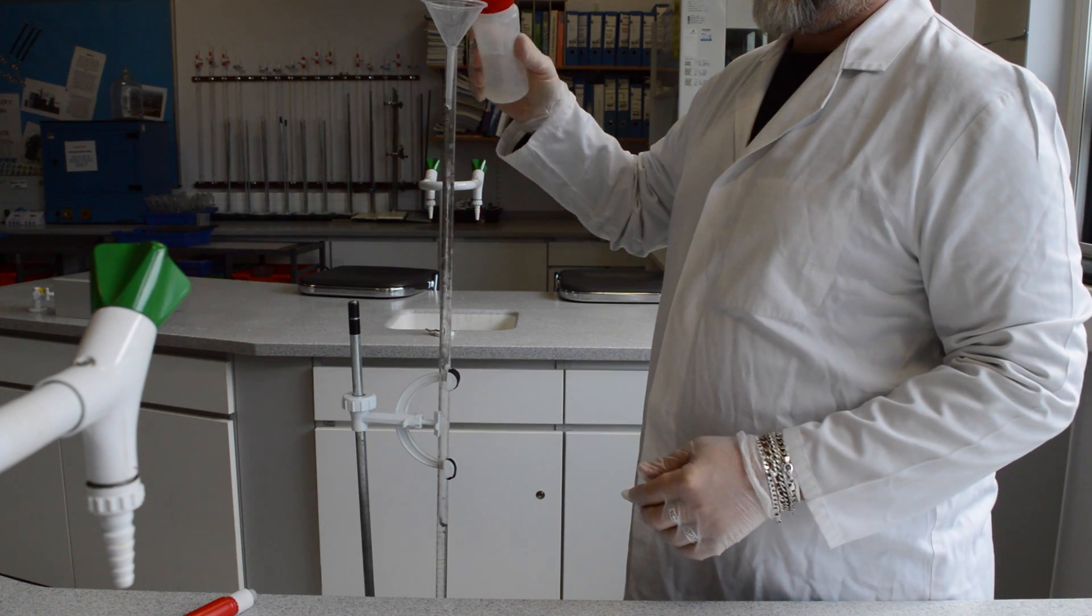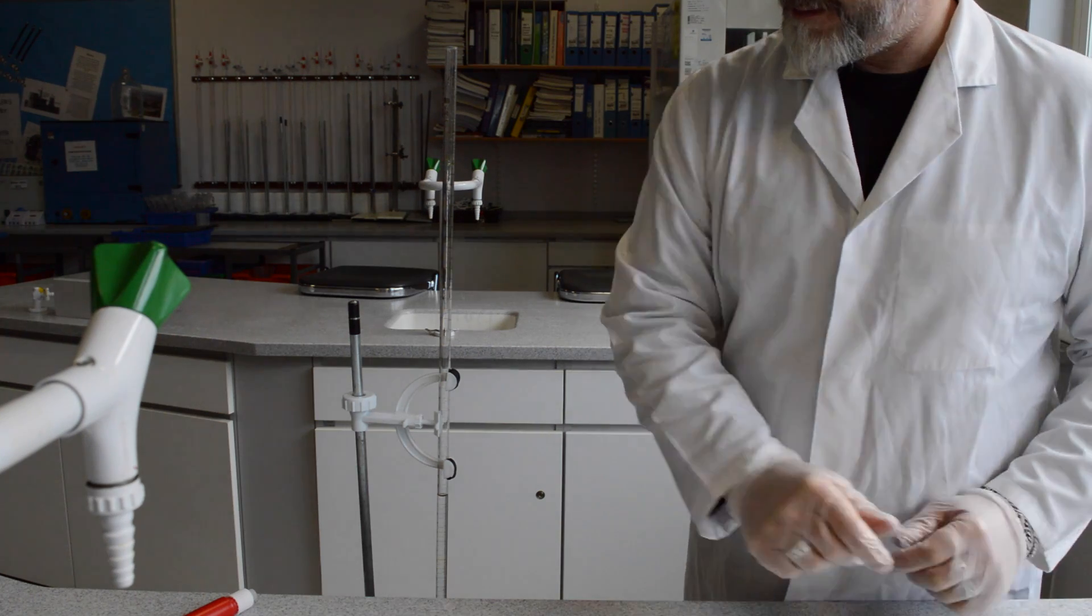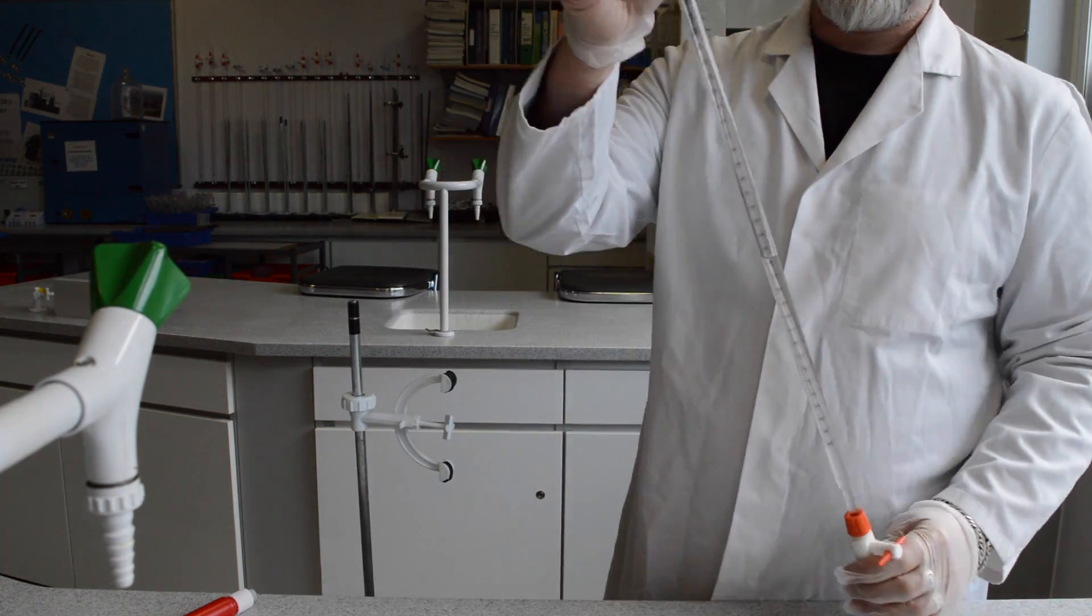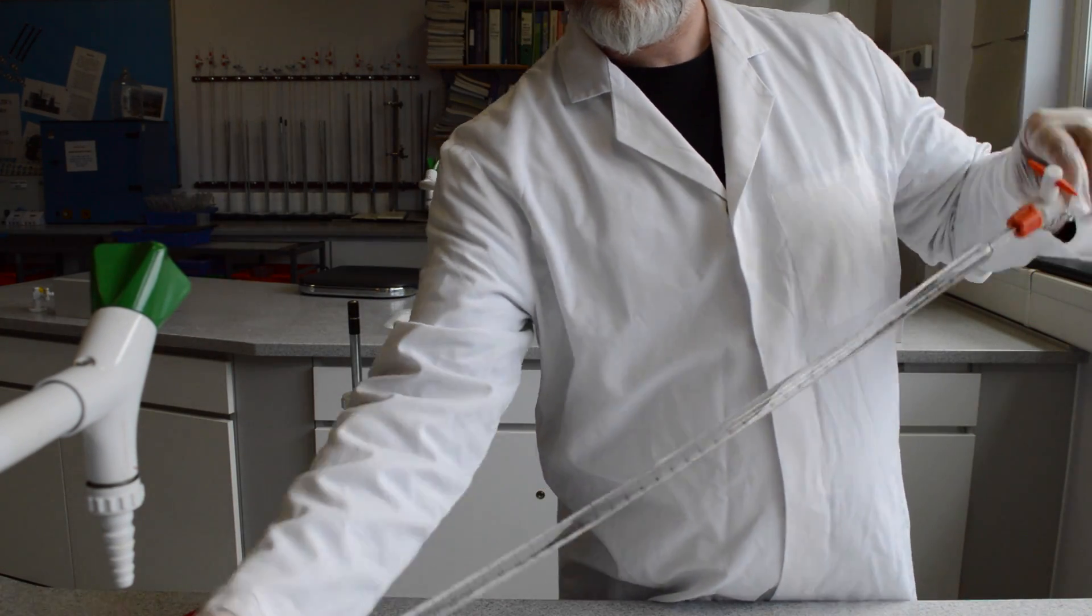In this case, as part of the conditioning of the equipment, distilled water is being used. Again, you need to perform this task twice to rinse out your equipment properly to avoid contamination during the titration.